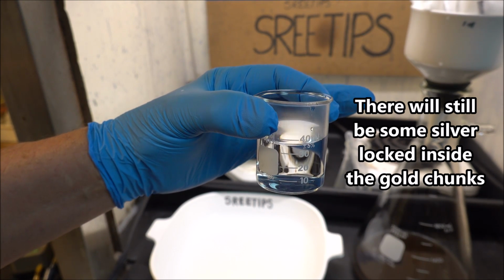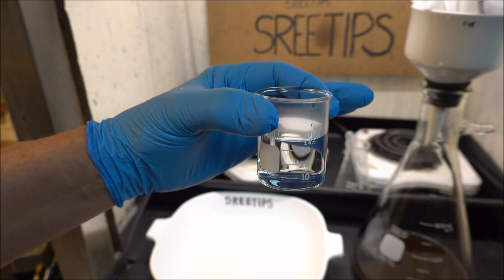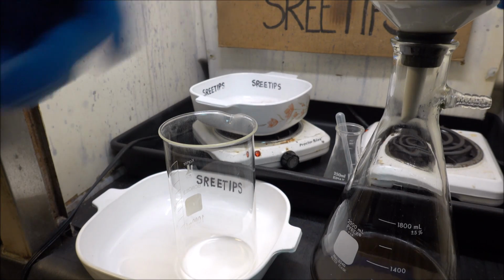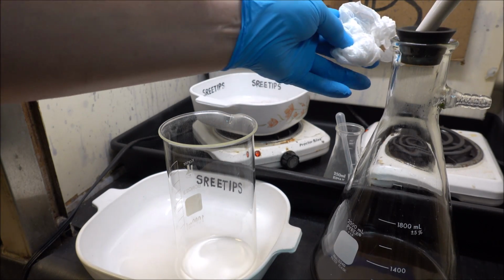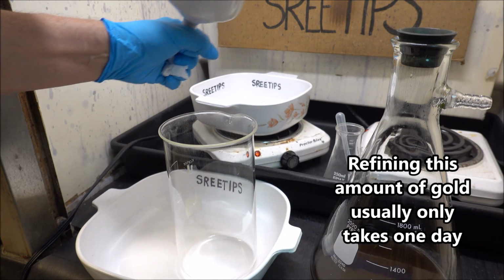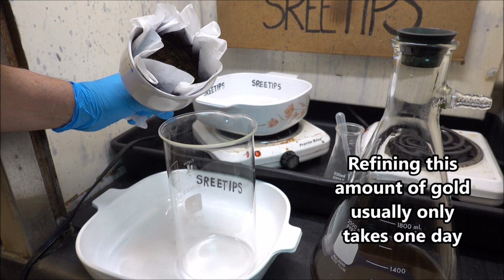So I think I pretty much got all the silver rinsed out of our gold. I've been working on this gold for about 3 days now, taking my time, trying to get all the silver out of there. And I think I finally got it.